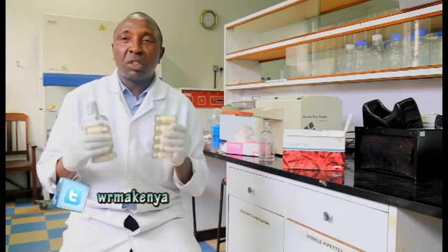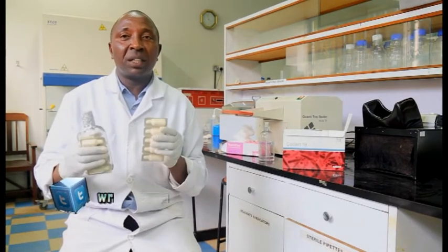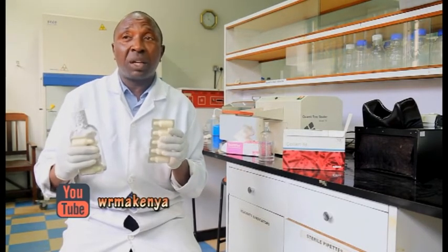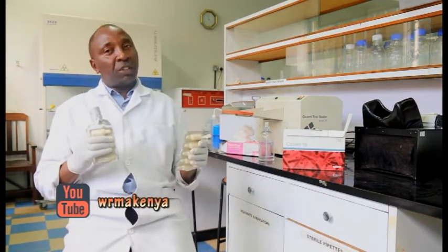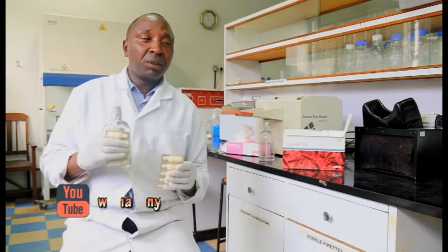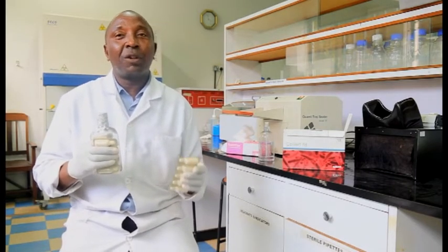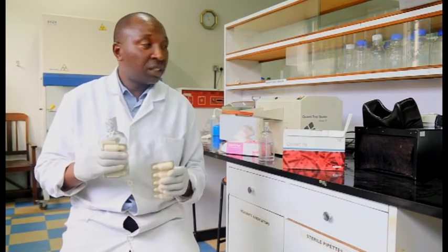We are able to tell the condition of their water within 24 hours or 18 hours instead of the 36 hours and sometimes 72 hours that we used to take in the older method. So currently we can say we are more efficient in our testing, and it takes only one day, 18 to 24 hours.